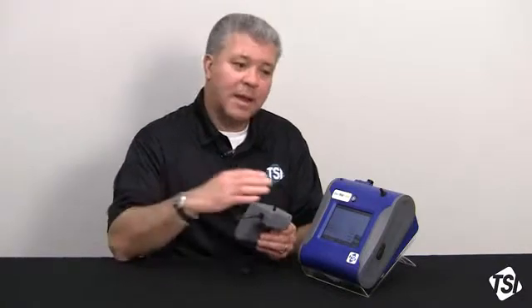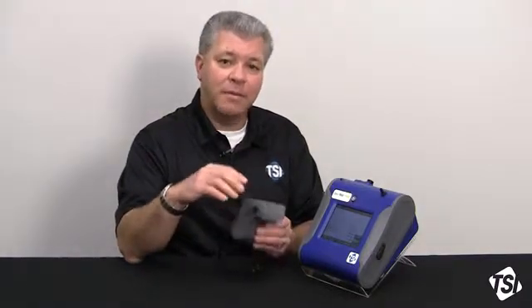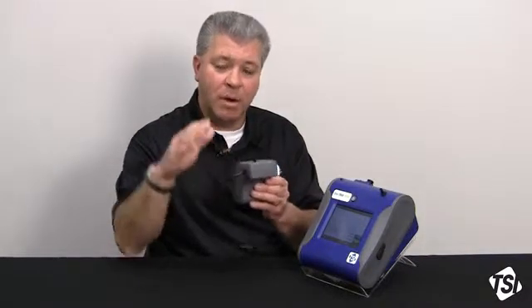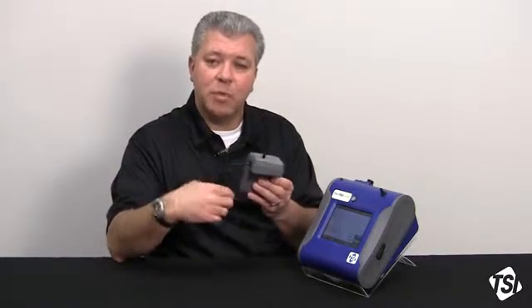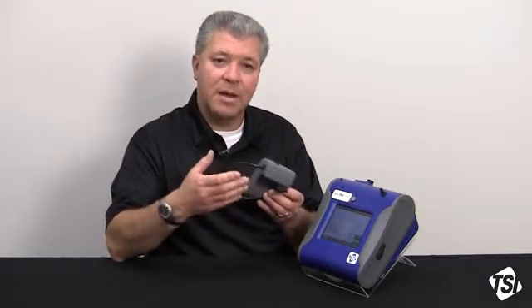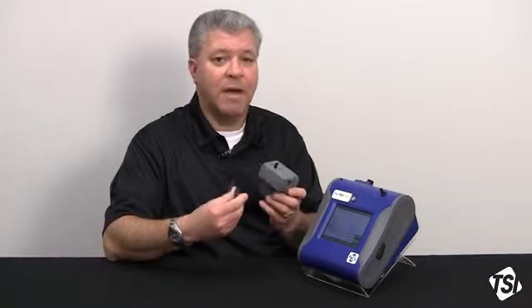By doing that, 2 minutes will certainly ensure that only one 2-minute data point will be lost, and will show up as zero data. Now, if you're concerned that doing it every 2, 3, 4 or 6 hours means these zero data points are going to affect your data, it will not. Even during a 2-minute log interval, half of that time will be zero concentration, but half of it wouldn't be. So your data really is going to be reduced, but it's not going to have the effects be shown at all in the overall logged average data.